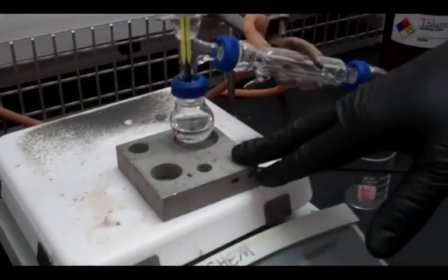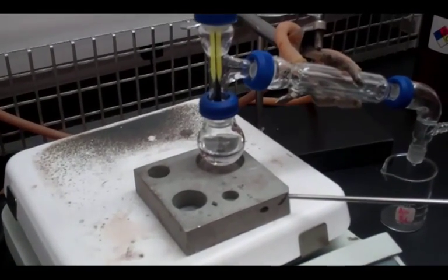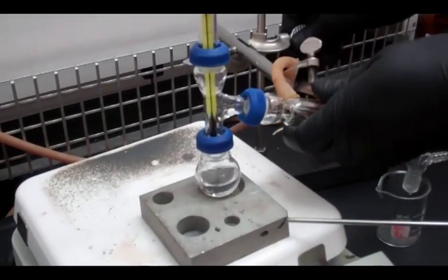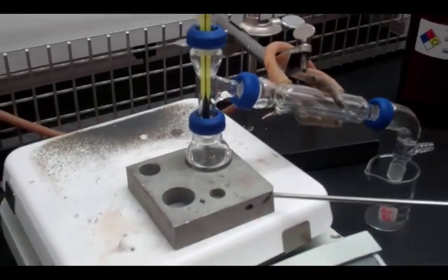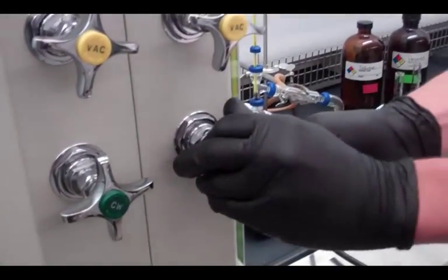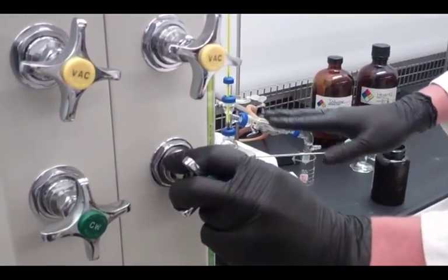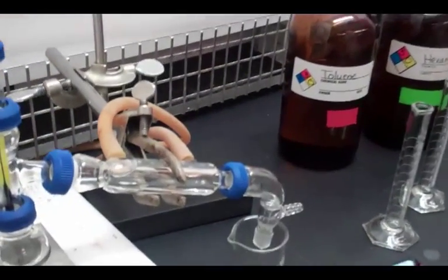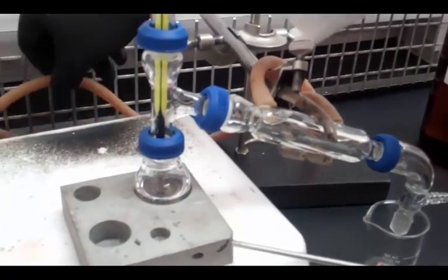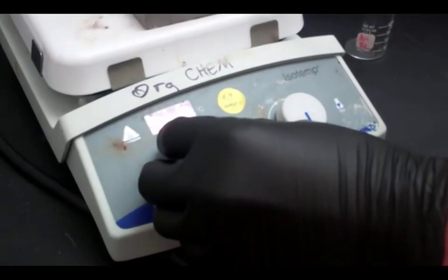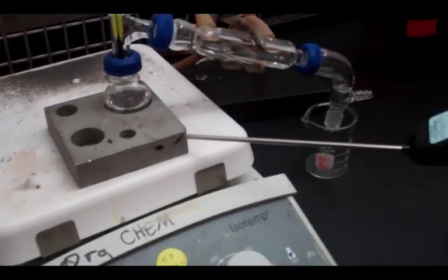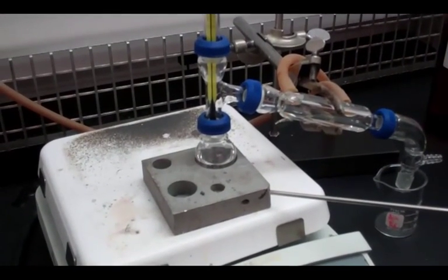So now what we are going to do, we have a plate here, a heating block and what that is going to do is disperse the heat and allow it to get all the way around the round bottom flask and heat the whole thing evenly. So we are going to go ahead and lower this. And now a very important part that you don't want to forget is to turn the water on to the condenser so we don't lose any product. You want to do that very slowly so you don't make the tubes pop off or anything like that. You don't need much, just a little bit. You want it to come out of the end of the hose just about like that. Not a whole lot of water. Now we can go ahead and turn on the heat. And we are going to let this sit for a little bit. It is going to take a little bit of time for it to get up to temperature and we will show you once it gets going.